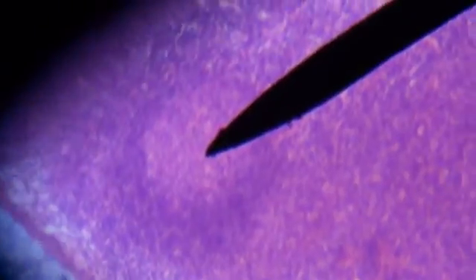Here we're looking at the lymph node, and the arrow is pointing at one of many germinal centers. It is actually the lighter, pinker portion of the lymph node, and you can see it surrounded by a very dark area — that's how you know you're looking at your germinal center.